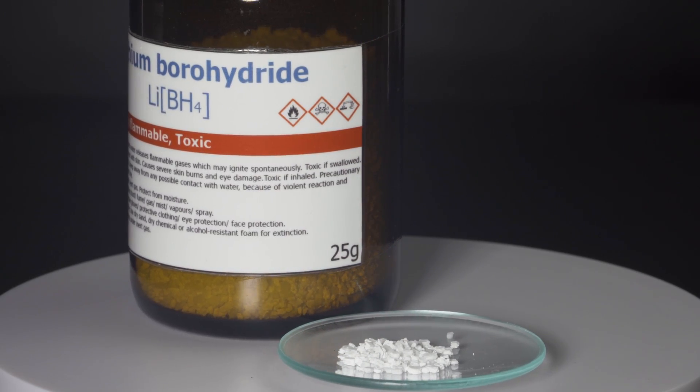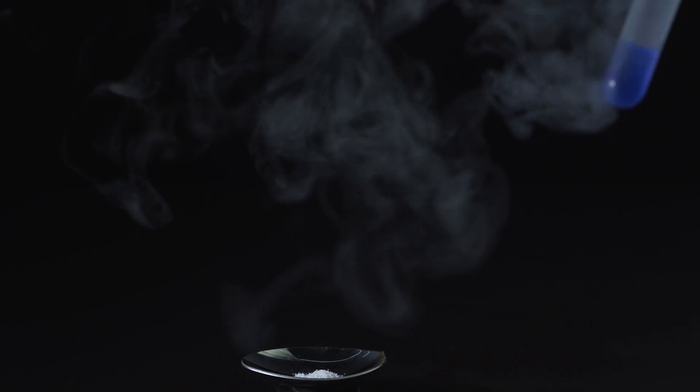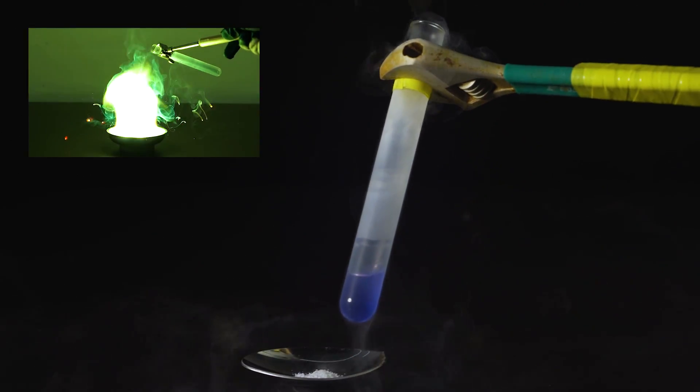Now let's move on to reactions with borohydrides. The first reaction will be the one with lithium borohydride, that I'd recommend to compare to the reaction where I used pure liquid oxygen.